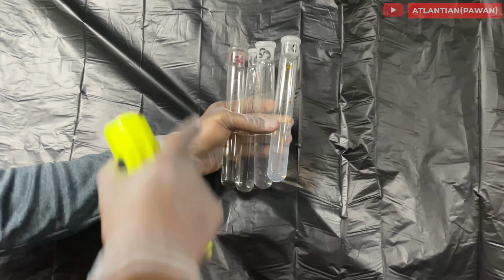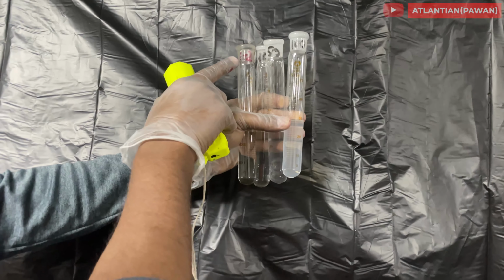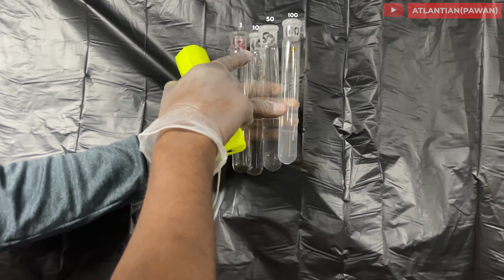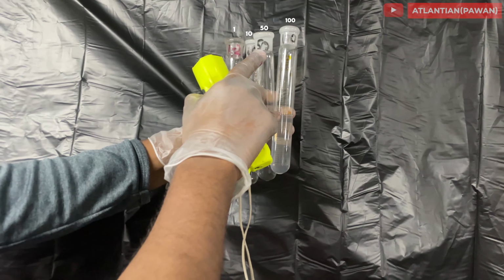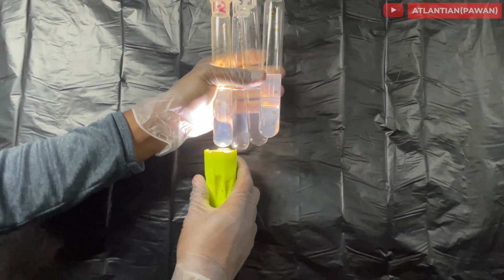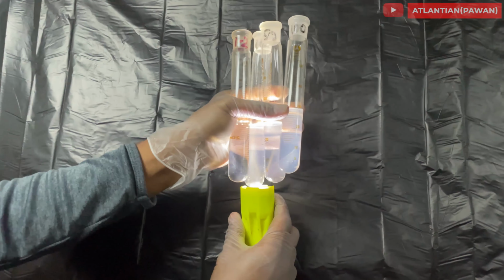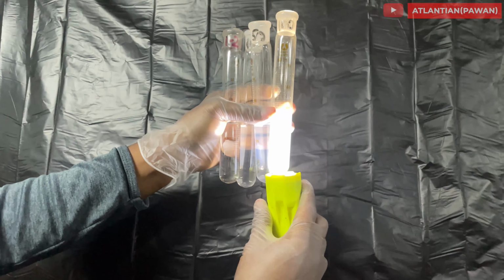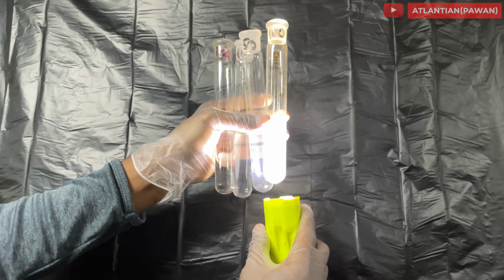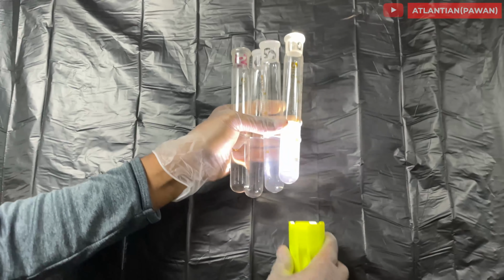So just to show you different examples, here I have 4 Nessler tubes where you can see we have 1 to 2 FTU, 10 FTU, 50 FTU and 100 FTU. But please note that if you have even 1 to 2 FTU, your tank will be considered a fail for the hydrocarbon test. Okay, but just to show you a clear picture of different examples of FTU, I'm showing this, but in light it is not clearly seen.